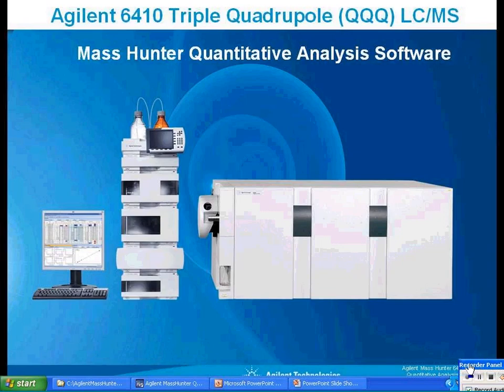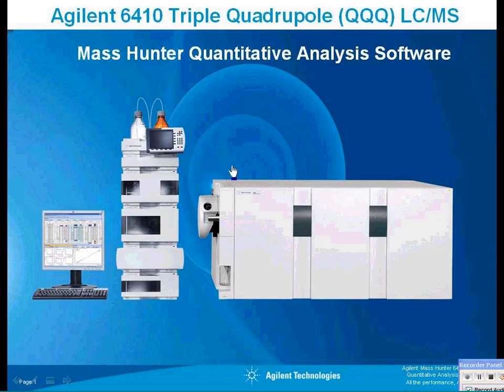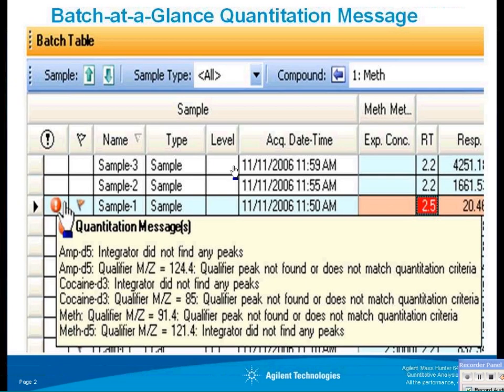Hello. I'd like to talk a bit about the quantitation message and its role in batch at a glance. What I'll show you is the information that the quantitation message delivers.